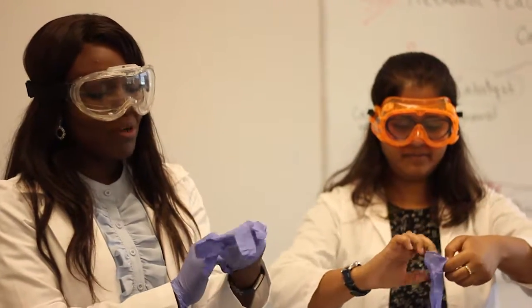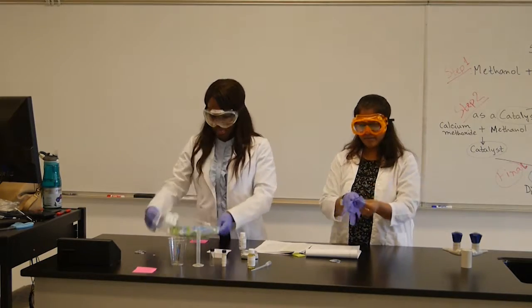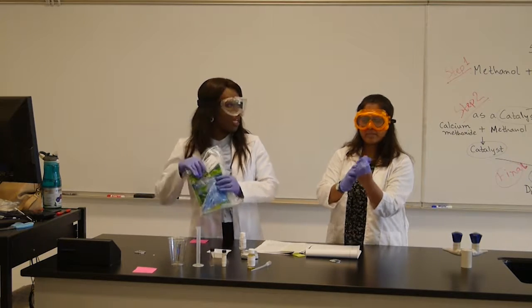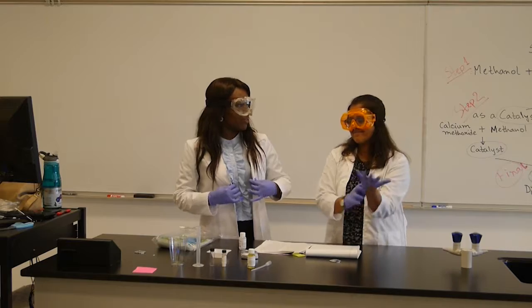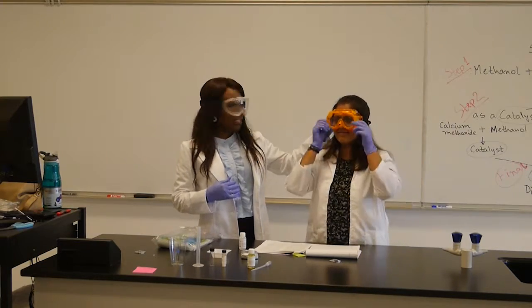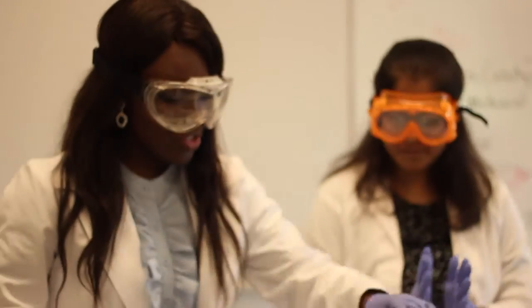Wearing the safety equipment is very important for the lab. Make sure you take the time to get the proper safety equipment. As you can see, we're wearing our lab coats. You are provided with an apron which comes in your lab kit. You're provided with nitrile gloves too, and you are provided with these very nice, handy dandy lab goggles. As you saw Miss Tony, she adjusted it so it can fit her. Make sure you adjust it so it fits your head. Okay? Looks like we're ready to go for lab.